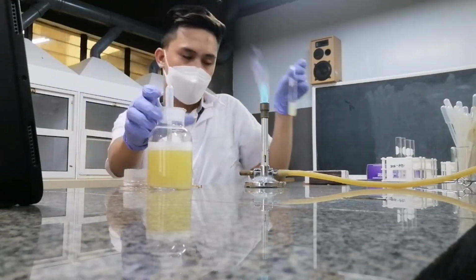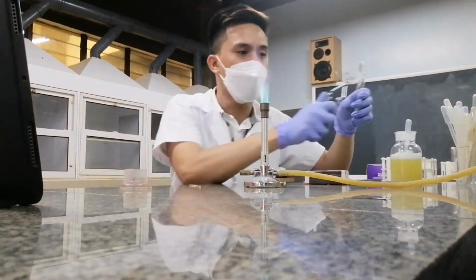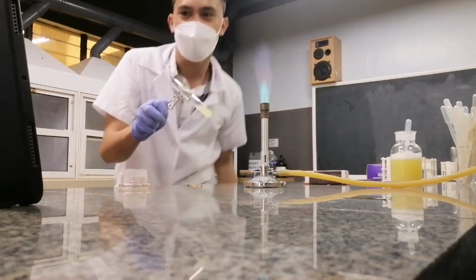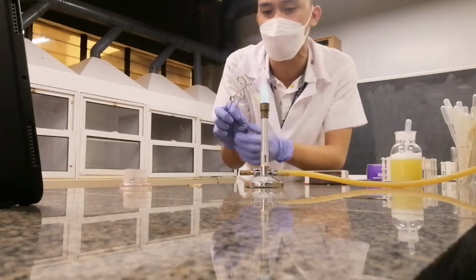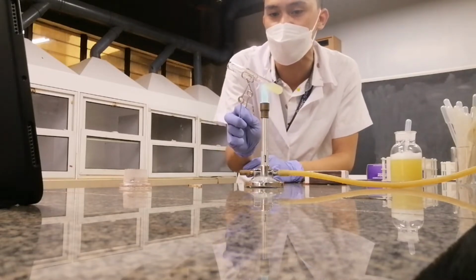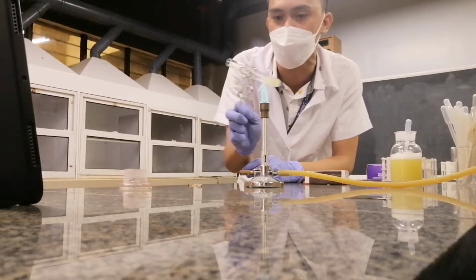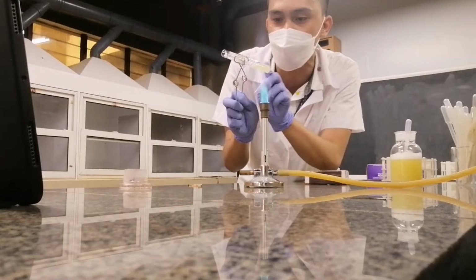Right. So let's try to see what happens to my egg albumin when I heat this in the Bunsen flame. Let me heat this like this. Again, heating of a fluid is always done at an angle of 45 degrees, and then you heat not at the bottom but at the surface of the liquid.